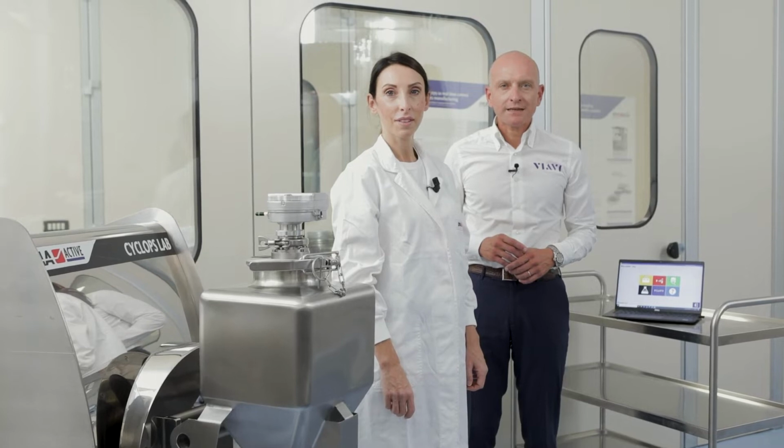Clearly there are three disadvantages. First of all, as I just said, you need to perform the analysis offline and bring the sample to the laboratory. The second point is that it's time consuming and also quite expensive because for every sample you need to go to the laboratory and do an HPLC analysis.